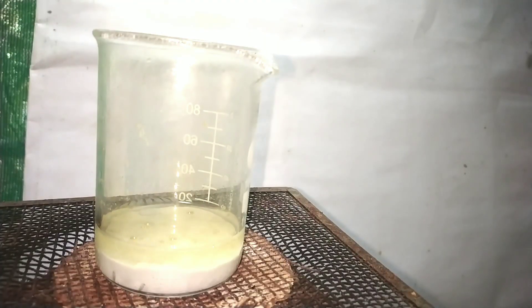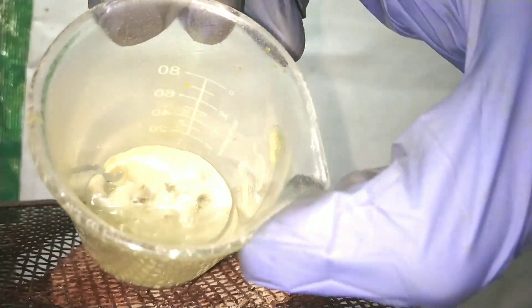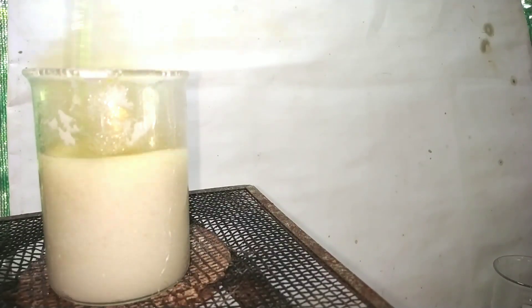After some time the reaction came to a standstill even though we have unreacted lead metal and nitric acid. That is because the lead metal pieces were buried by the precipitated lead(II) nitrate. So I added more distilled water to dissolve the lead(II) nitrate salt and started stirring to ensure the lead pieces are not buried by the salt. The reaction is proceeding well now. This is yet another reason for using dilute nitric acid instead of the concentrated one.